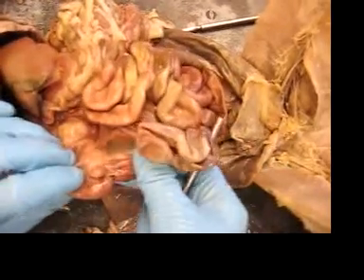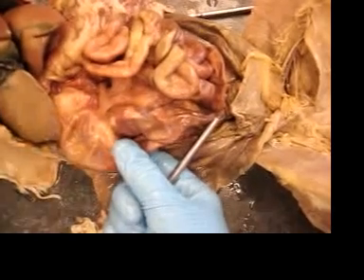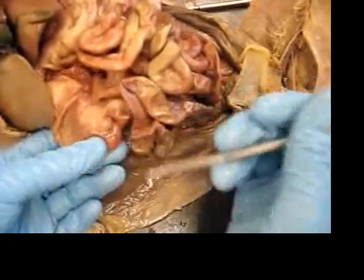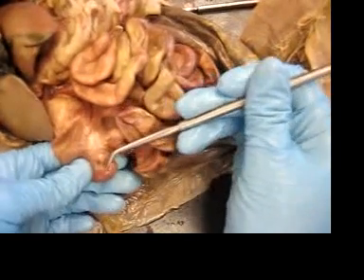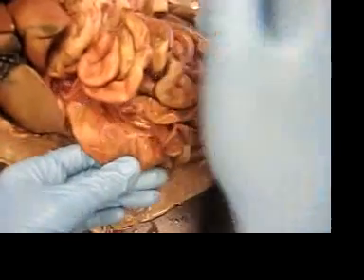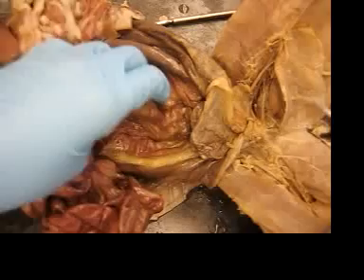Here is where it becomes the large intestine, and it's called the ileocecal junction. There's the cecum right here, which in animals that do hindgut fermentation, that would be enlarged and that's where the fermentation would occur. Then it goes into the ascending colon, the transverse colon, and the descending colon, which then exits out of the rectum.